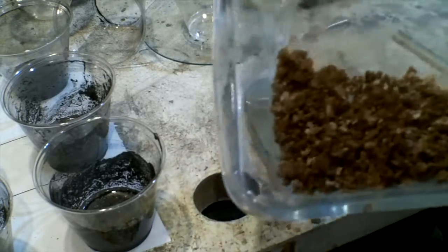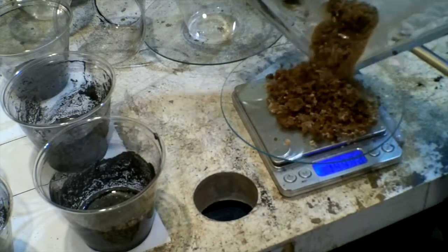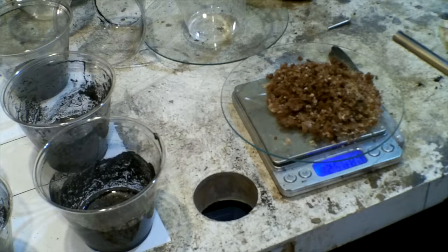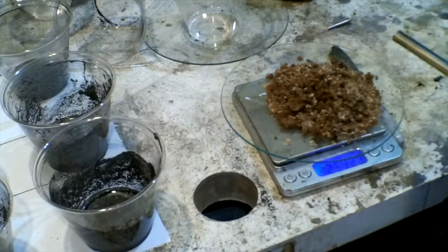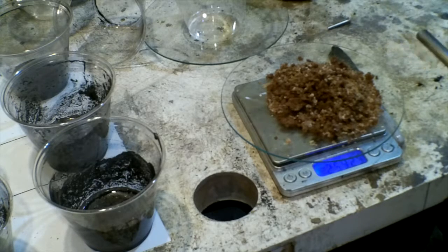It's a number of days after I tried treating that potash with my homemade activated charcoal, which didn't have much effect. I finally managed to dry it out. It's just really hard to get it totally dry — it sucks water right out of the air, it's very hygroscopic. 257 grams. There's a little bit left in the pan, but I got most of it. I could use it, but I don't want to because it's so brown.